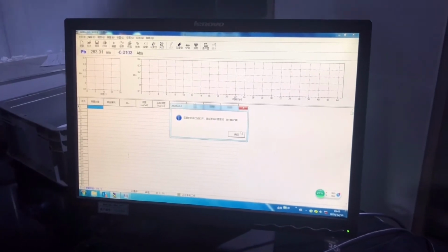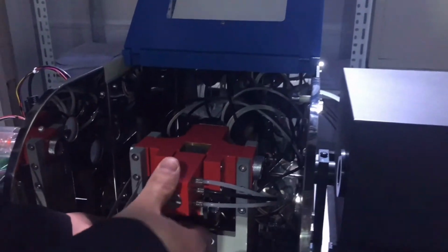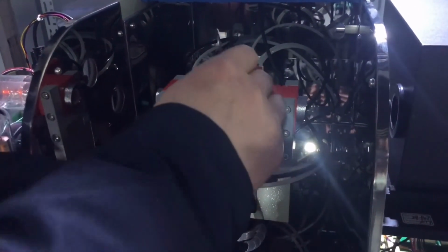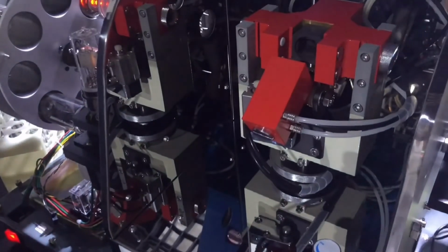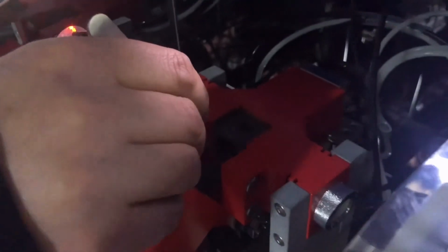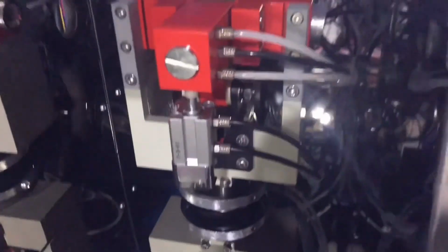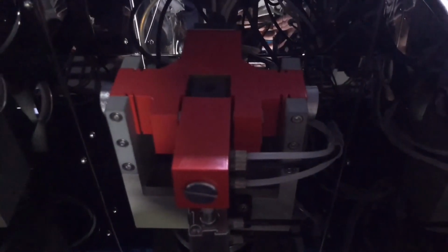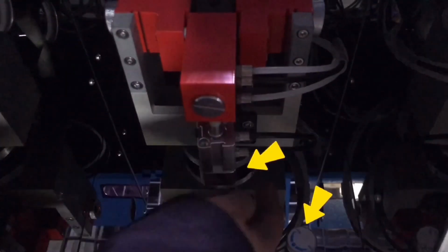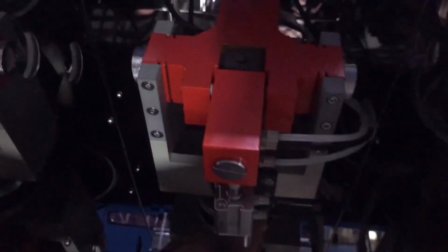Click the Graphite Tube button in the software, and then remove the bracket. You could insert the graphite tube into the graphite furnace. Do not touch the graphite tube directly with your hand. It's recommended to use tweezers to put the tube into the furnace, and then push the bracket back and click the OK button. The position will be located. There are two knobs you can use to align the position of the graphite furnace, the white one and the metal one. The white one can align the position from front to back, and the metal one can align the height of the graphite furnace.